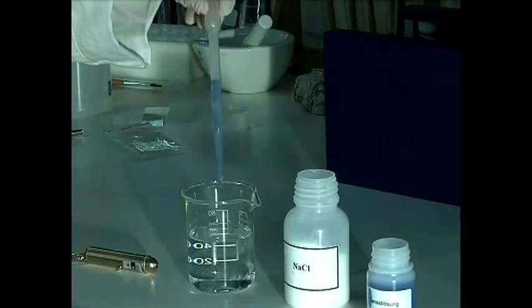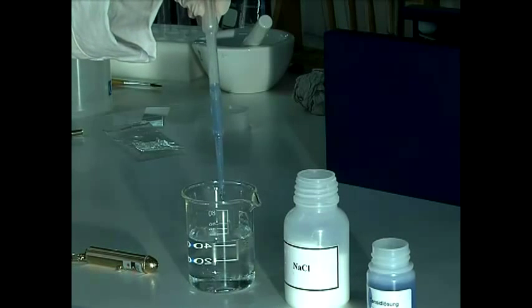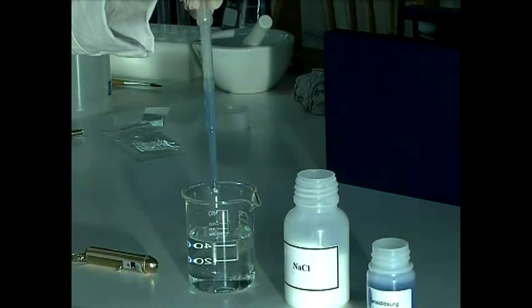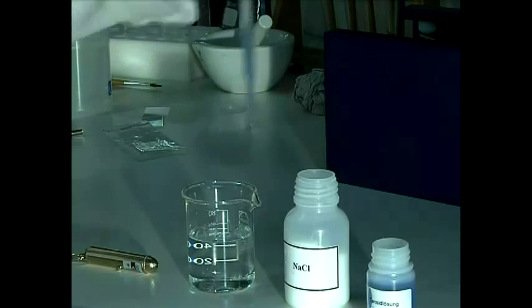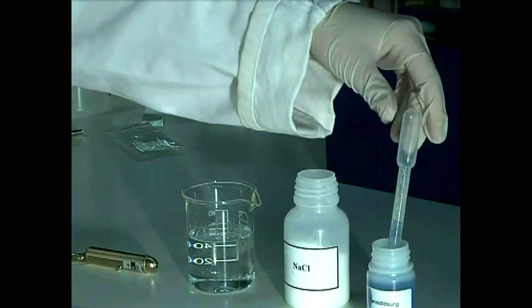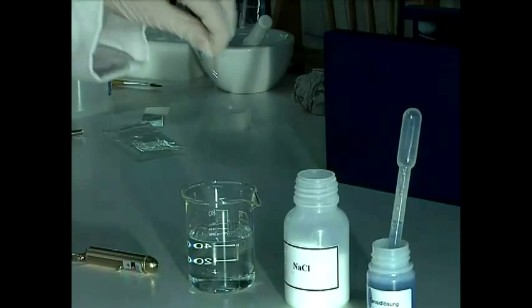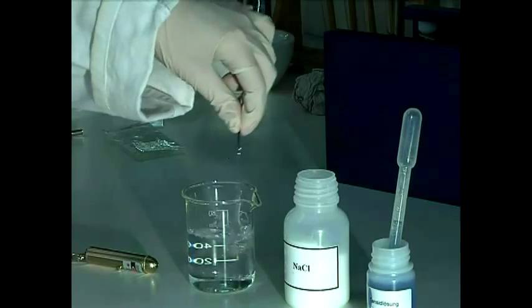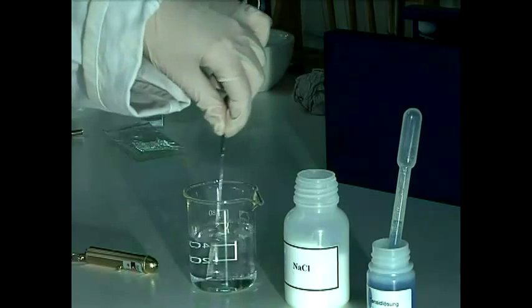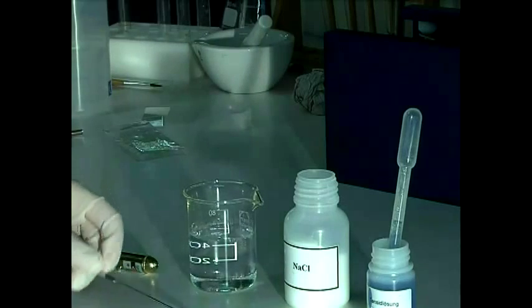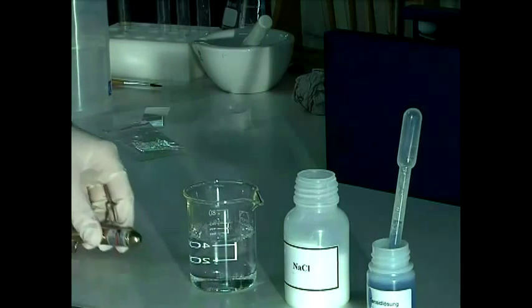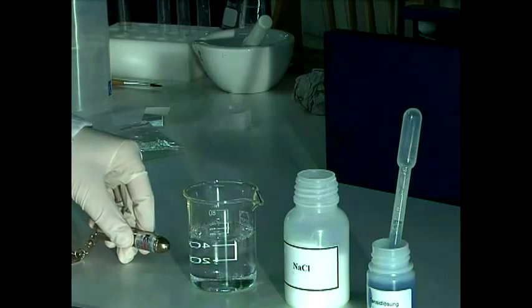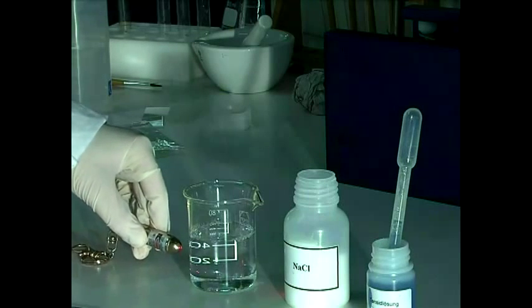Now, add a few drops of surfactant solution and stir thoroughly. If you now use the laser pointer to light up the glass, the path of the light is visible. So, what has happened?